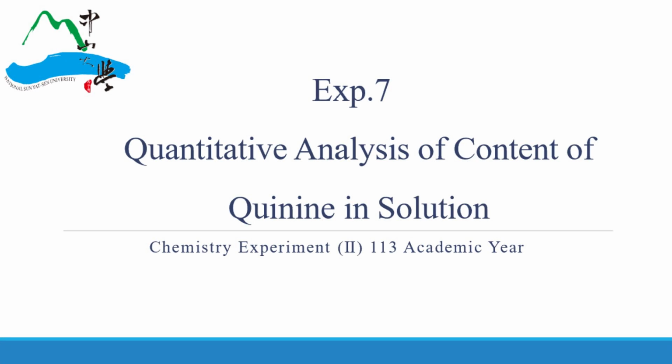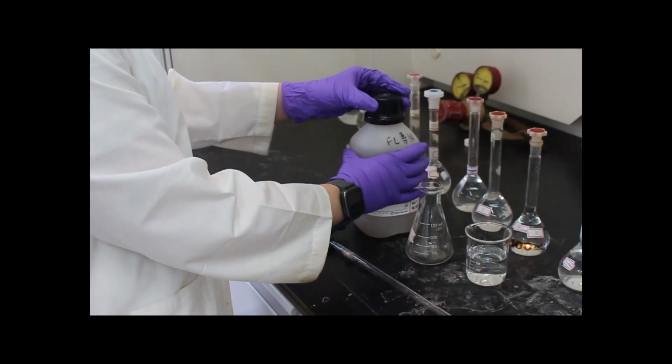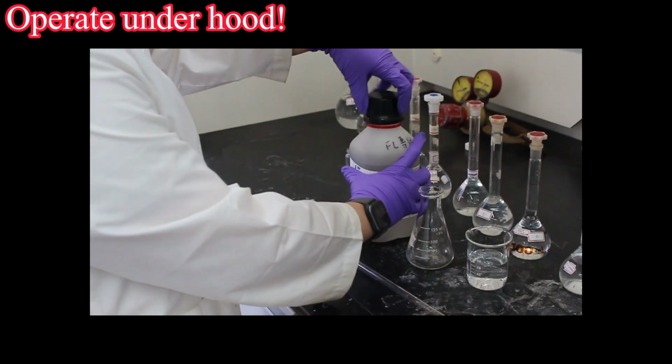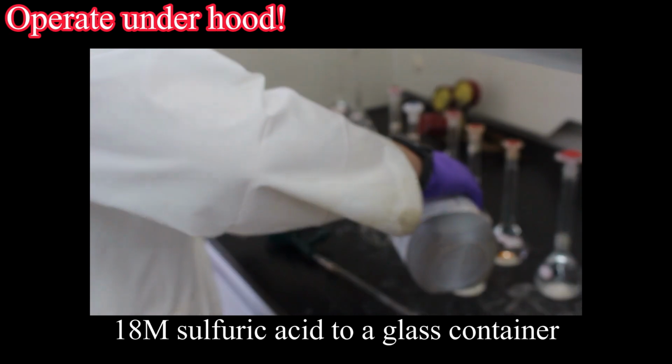Experiment 7. Quantitative analysis of content of quinine in solution. First, we are going to prepare dilute sulfuric acid solution. Note, operate under hood. Transfer a small amount of 18 M sulfuric acid to a glass container.